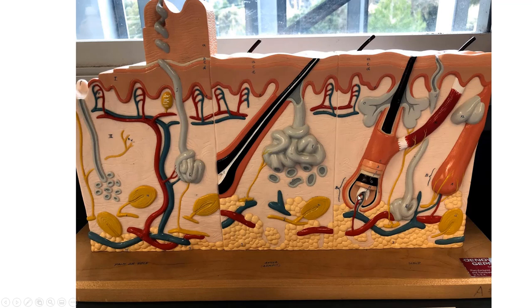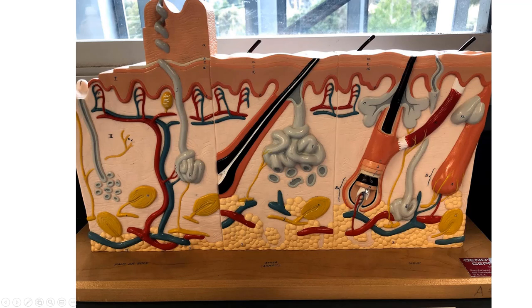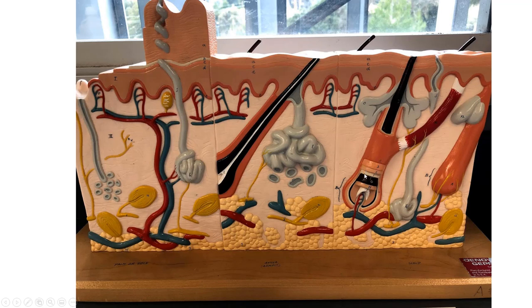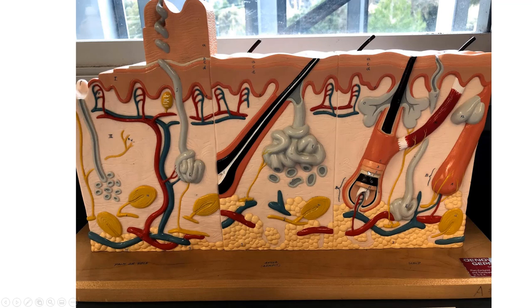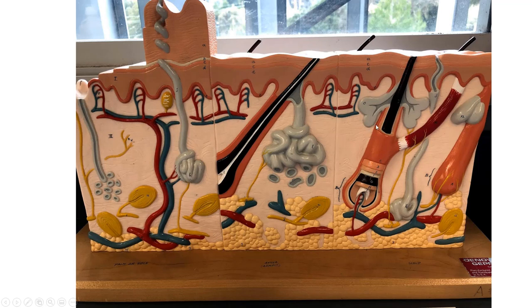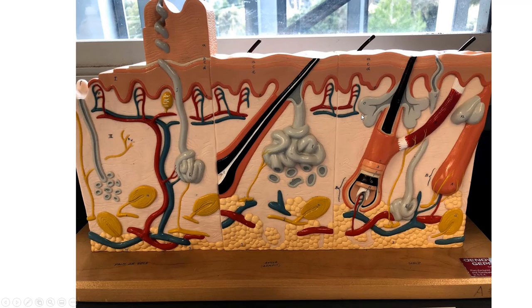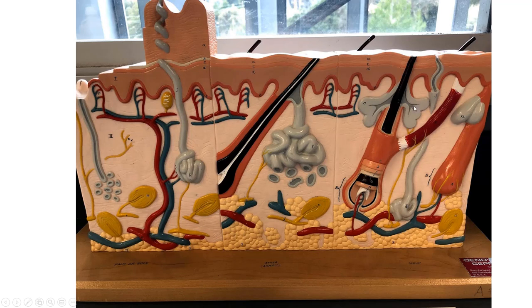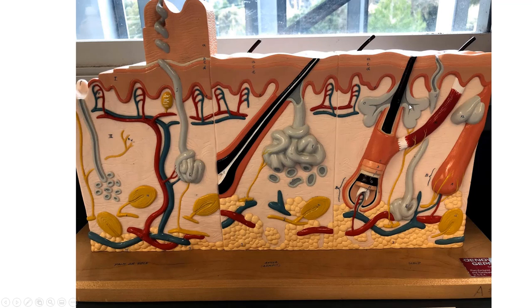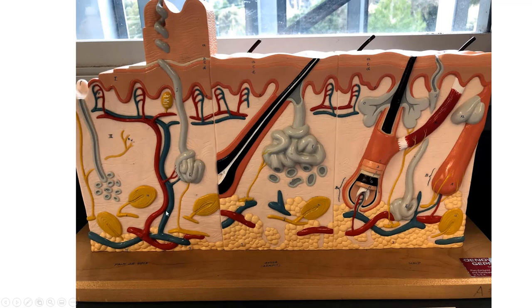As far as the hair follicle goes, you get the bulb, the papilla of the hair, and the matrix, where the cells divide and push up the different layers of the hair follicle. You can't really see too much detail here. Here's your arrector pili muscle that makes the hair stand up.